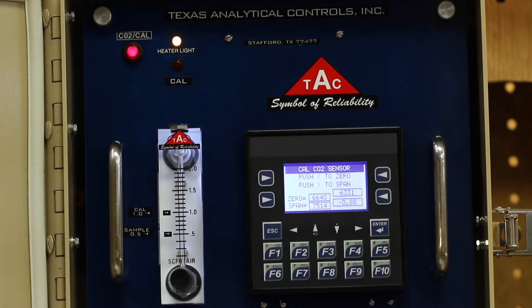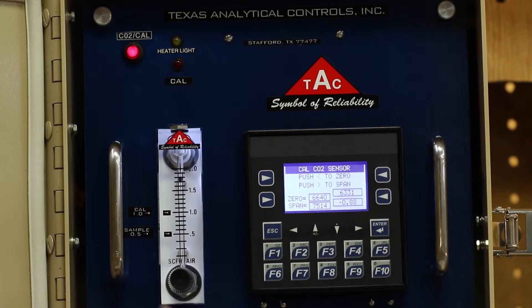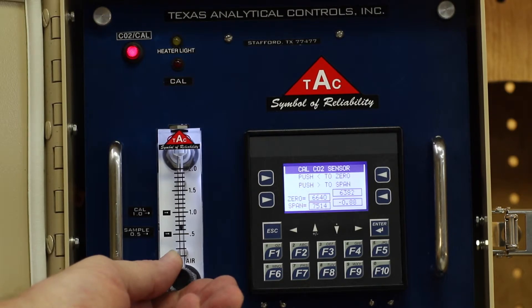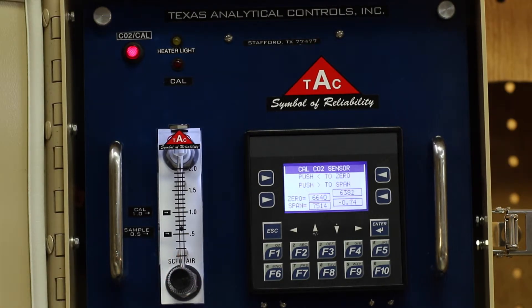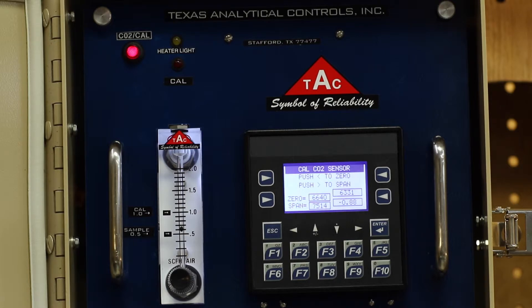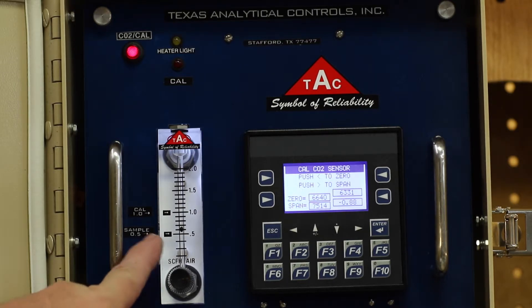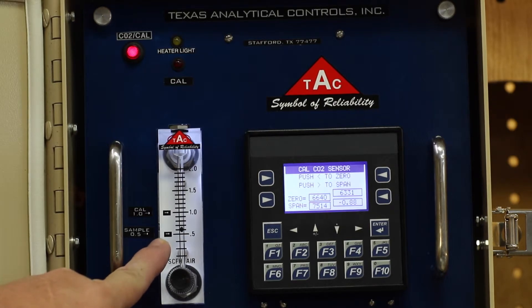Turn on your nitrogen bottle. Adjust your flow between 0.5 and 1. Where you set the flow meter is not critical — it is important for the analyzer to have a steady flow. Note the arrows on the flow meter are for the settings to set H2S.